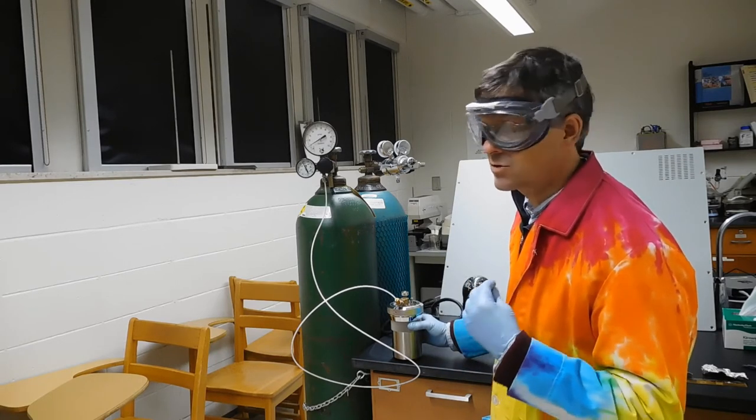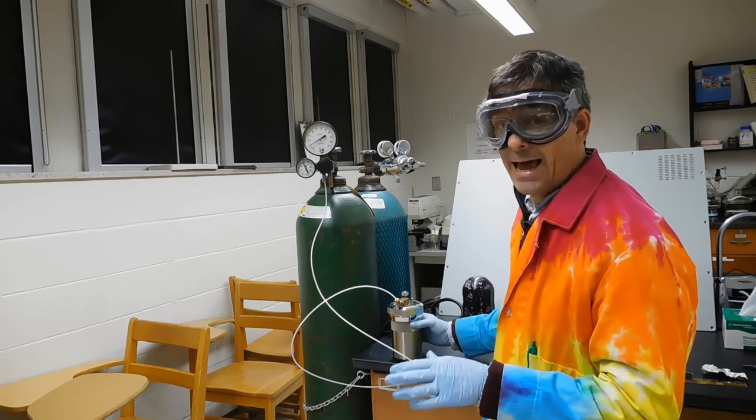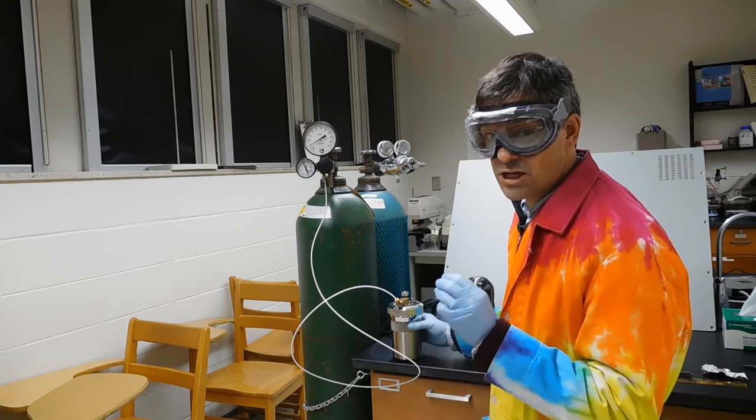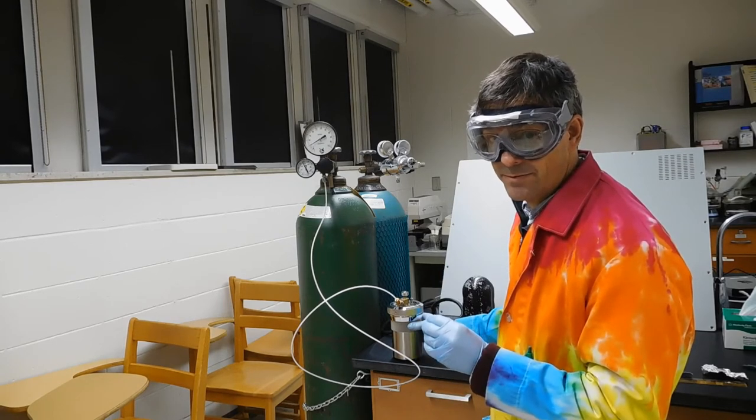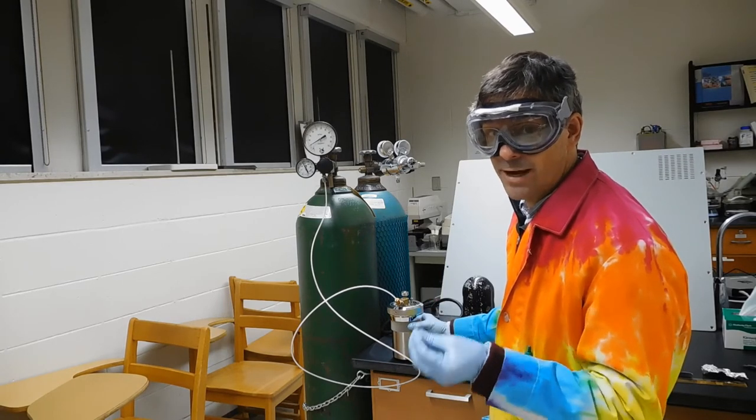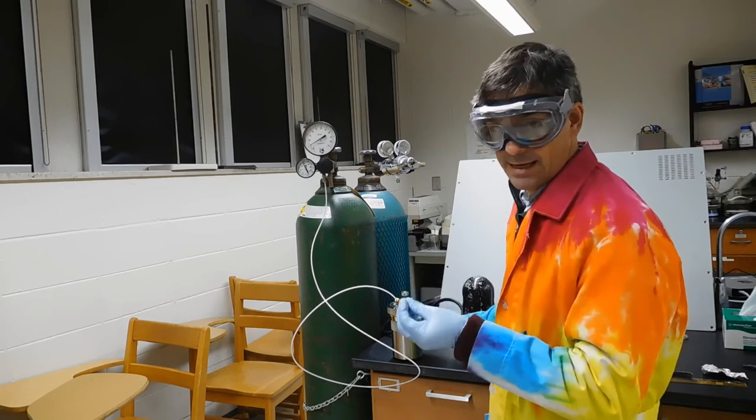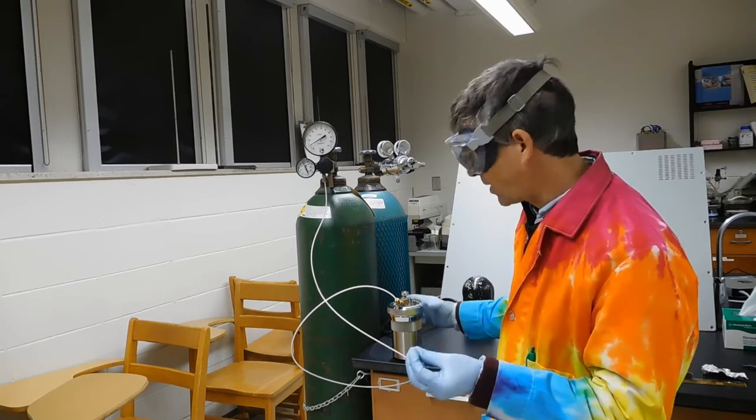So what I'm going to ask is that, although I'm demonstrating this to you, the first time you fill the bomb during class, you make sure I'm watching you, because it's easy to get a little bit confused about what you should do.